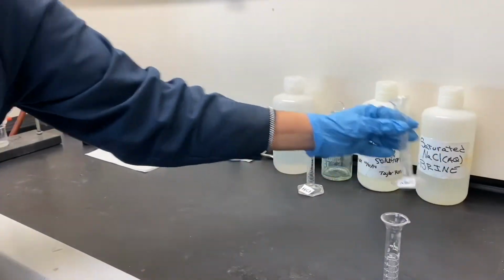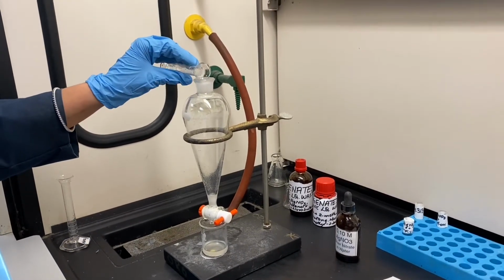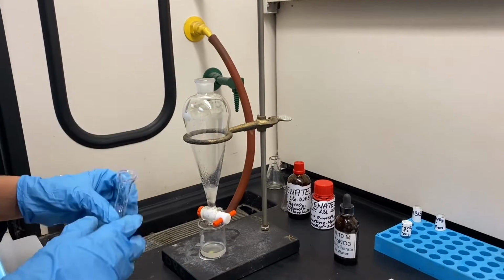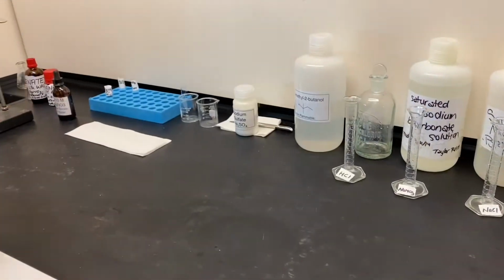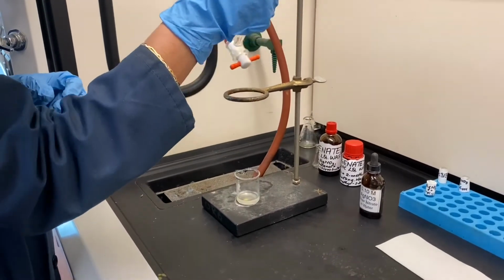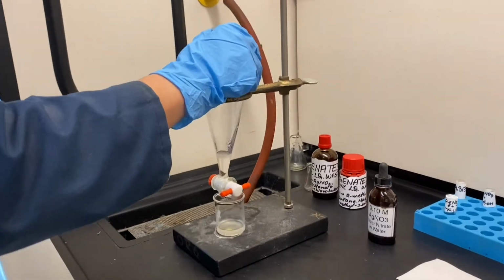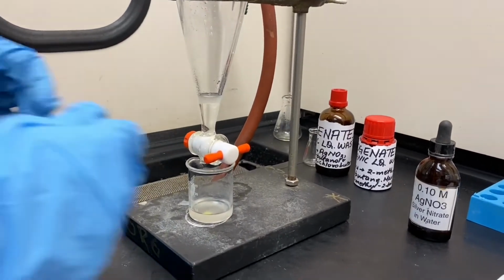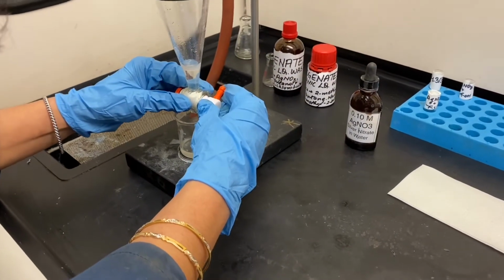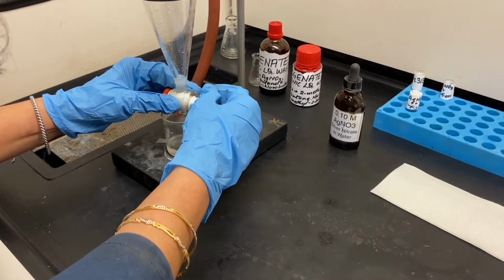To this organic layer, we will now add approximately 2 ml of saturated sodium chloride. Again, this is not one of the starting materials. We do not need to record the exact amount. Again, just swirl the solution in this funnel to mix well. Sodium chloride decreases the amount of organic product dissolved in the water. Once the layers separate, we will drain off the aqueous layer into the same beaker again.